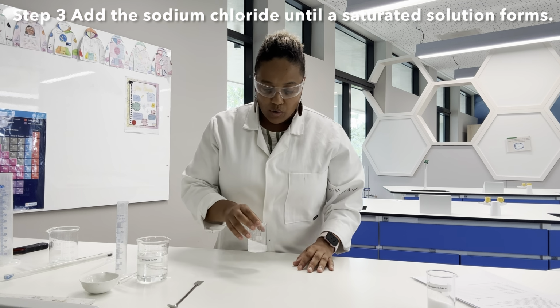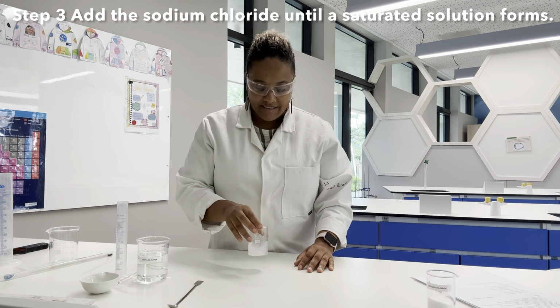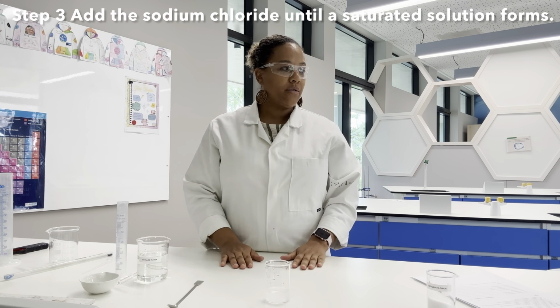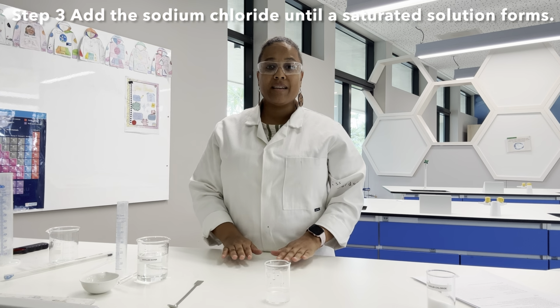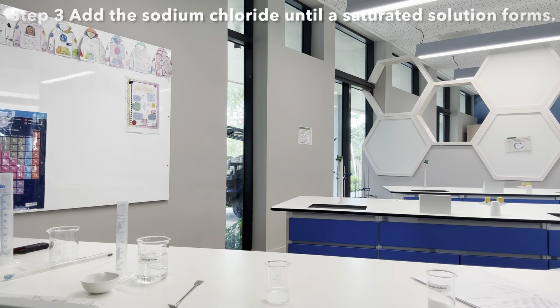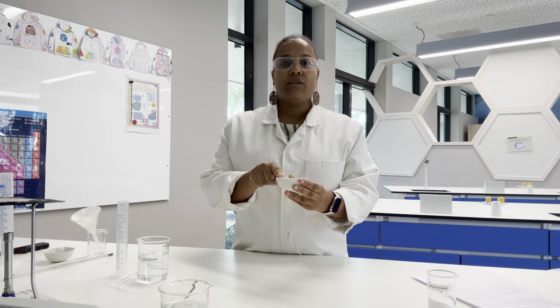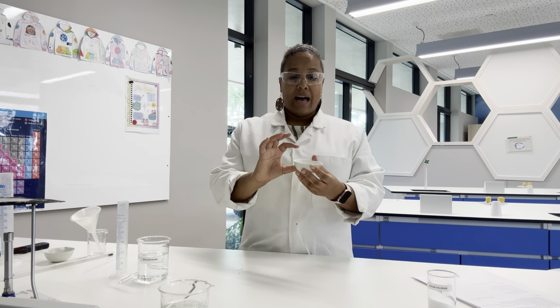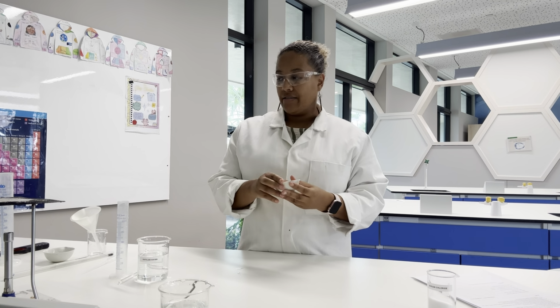Now, we want to get rid of that excess that is in there. So we're going to need to filter. So the next step is filtration. We're going to filter our crystals into this evaporating basin. But before we do that, we need to make sure we measure the mass of this evaporating basin so we can work out how much solid we've got at the end.